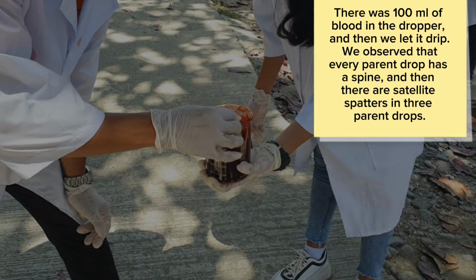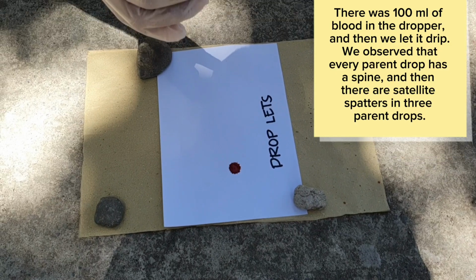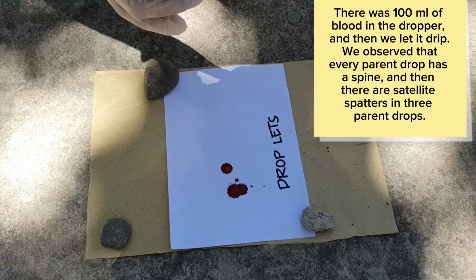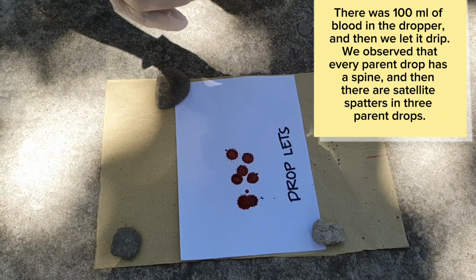Part 1. Bloodstain pattern. 1.1 Passive blood pattern. Droplets. There was 100 ml of blood in the dropper, and then we let it drip. We observed that every parent drop has a spine, and there are satellite spatters in 3 parent drops.